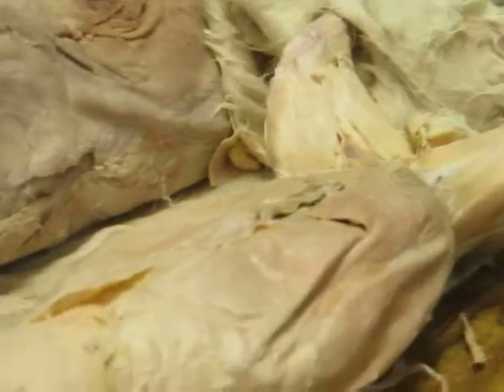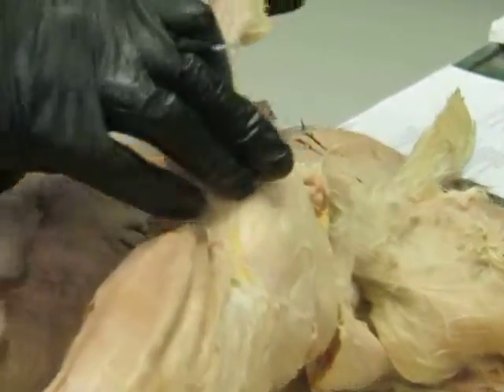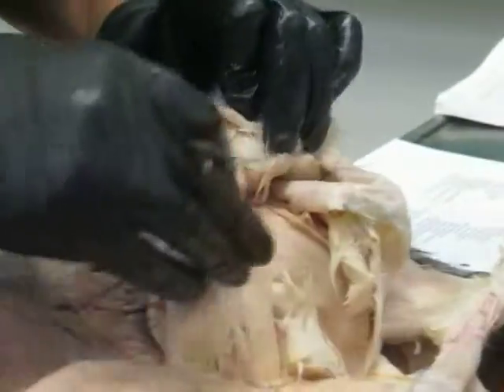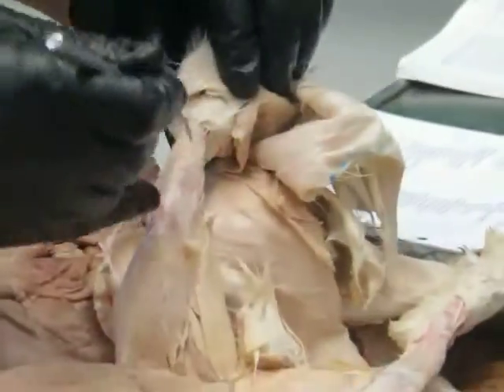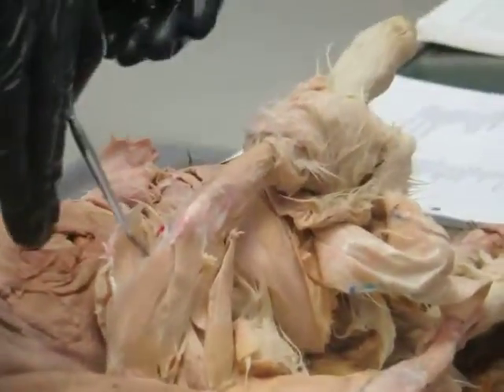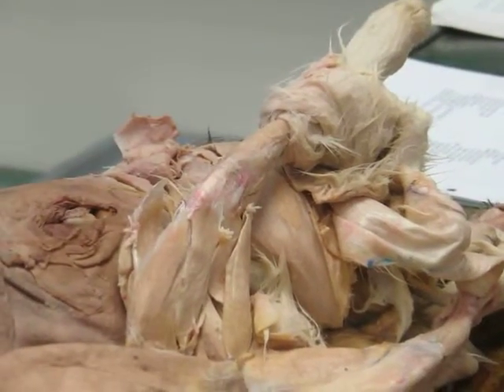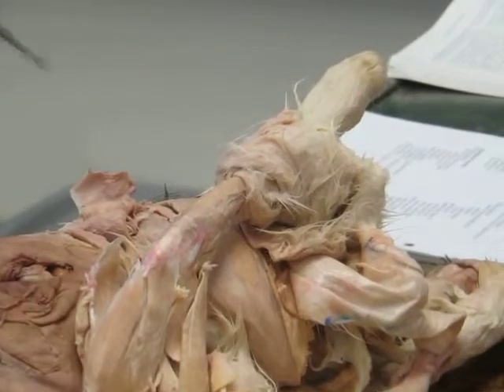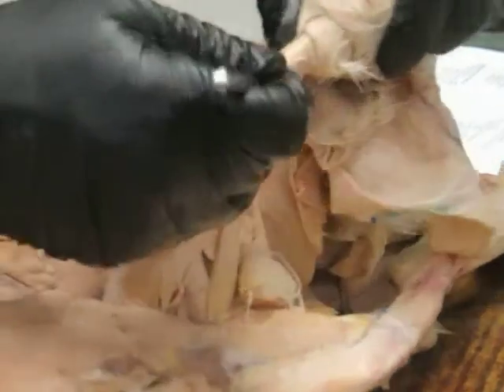Okay, so then we come down to the muscles of the shank. Okay, where are they? On this side. And there's not a lot I asked you to learn here, but there's just a few. Basically, on the front of the shank, there's a muscle that's the primary extensor of the ankle, or dorsiflexor of the foot, as we call it in humans. And that's the tibialis cranialis, and it's this muscle right here.